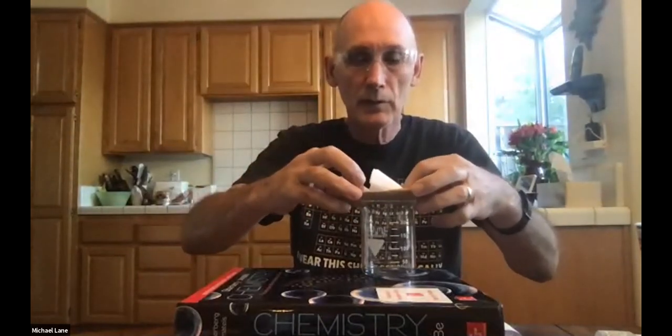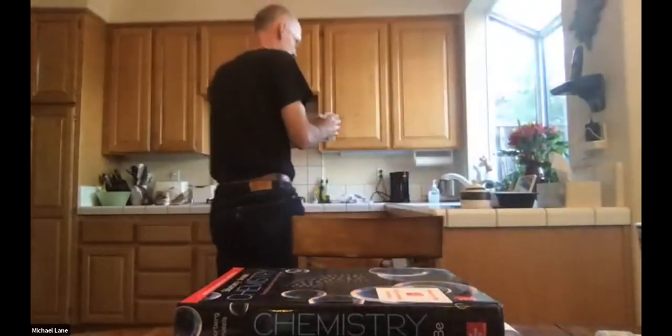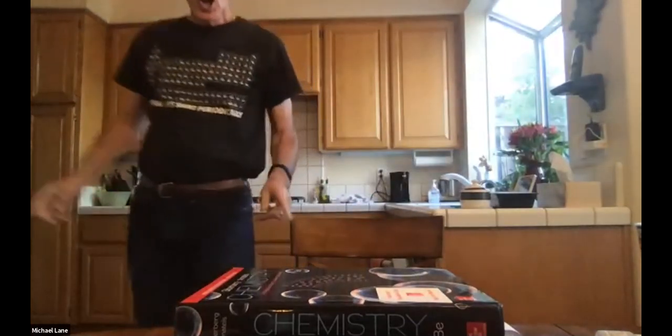Now, the procedure says to put it in a warm window. Well, at least in the Northern Hemisphere, we're approaching winter at this time. But I've got that set aside, and I'm just going to set it someplace where it'll be warm. Do not try to dry it off in an oven or a microwave or anything that involves direct heat. The likely thing that would happen is you would burn or char the filter paper or otherwise lose material and, of course, get catastrophically bad results. Okay, there we have most of the procedure.